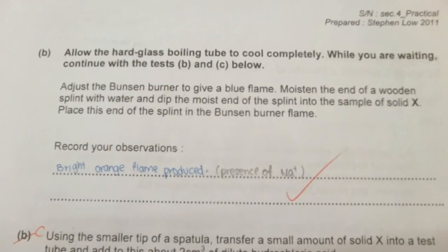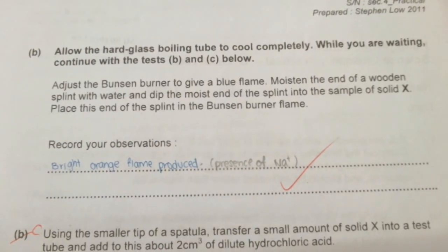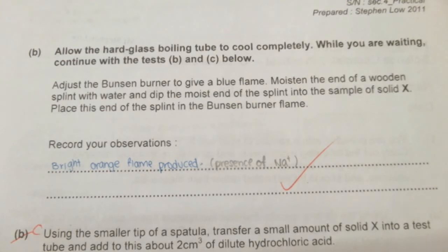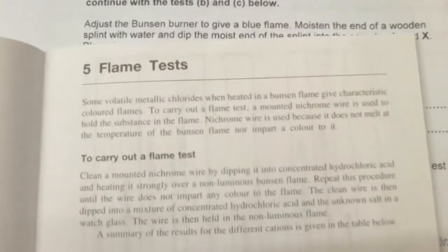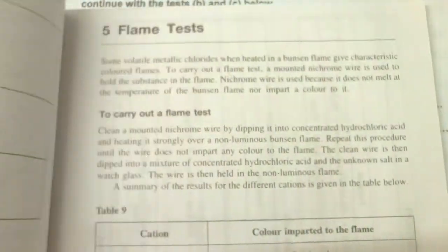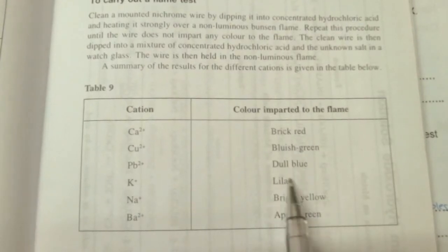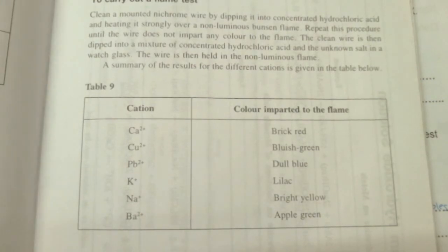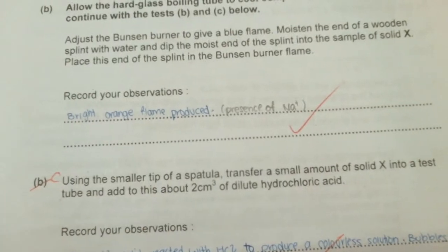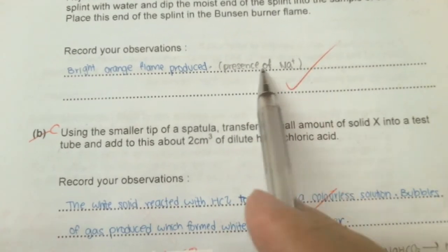The next part is a flame test, where you heat a sample of solid X and observe the color of the flame. From the color of the flame you can identify the cation present — this is called the flame test. From the reference book, a bright yellow or bright orange flame indicates that sodium ions could be present in solid X. A blue-green flame would rule out the presence of sodium ions, although confirming sodium is not required.